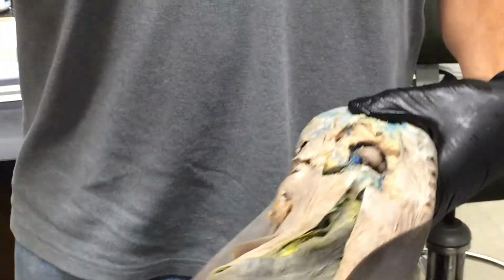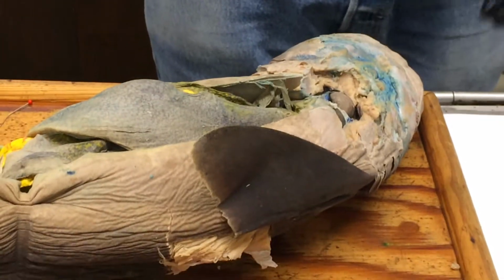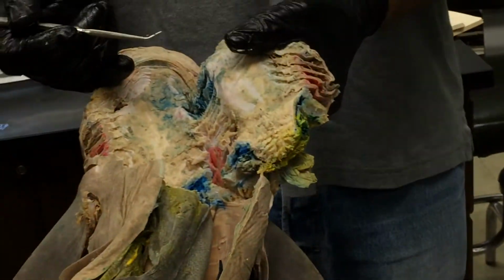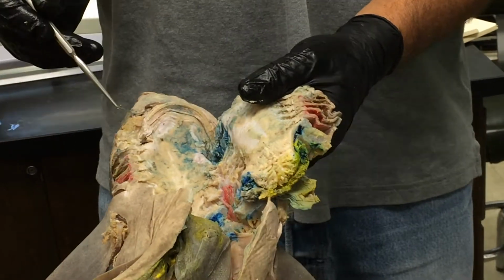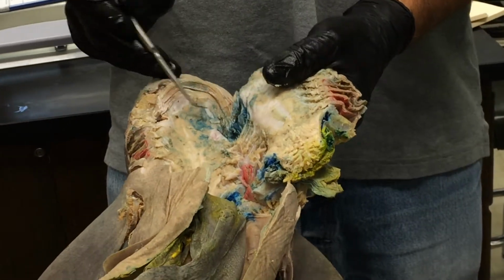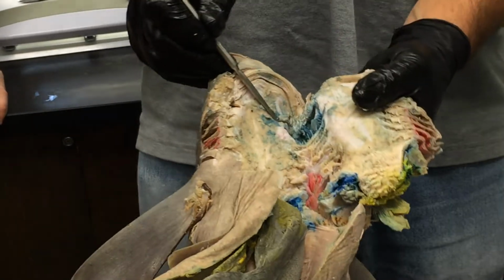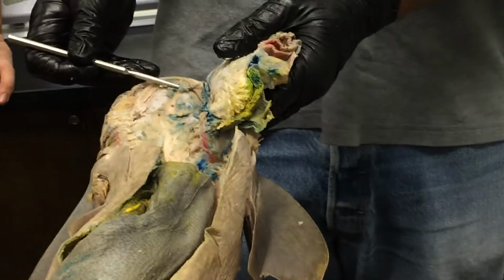All right. So that's it for the digestive stuff. Then we have the respiratory stuff, the oral cavity, pharynx, and respiratory organs. And so hopefully your shark got opened up something like this. And you can see there's an oral cavity and a pharynx. It's hard to figure out exactly where the boundary is, but the spiracles should be approximately at the boundary between oral cavity and pharynx. So pharynx behind, oral cavity in front.